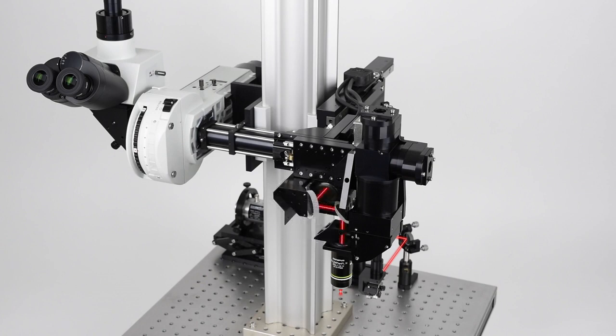Once the sample is illuminated with excitation light, the emission light is collected by the objective and reflected to the detectors with a dichroic mirror. The PMTs in the detector will collect the emission light, whether it's a 2-channel detector with 2-inch collection optics as shown here, or an alternate short-path 2-channel detector, or even an optional 4-channel detector.